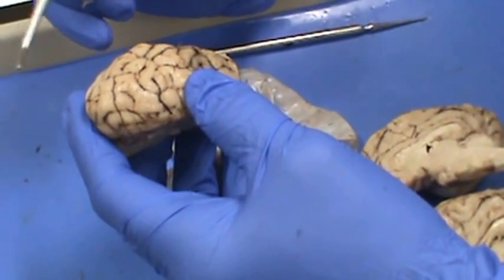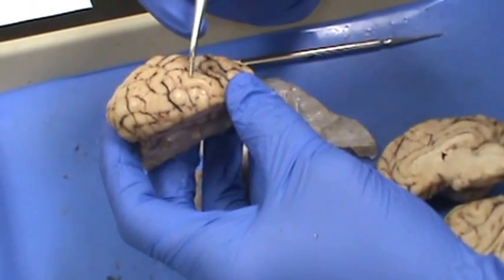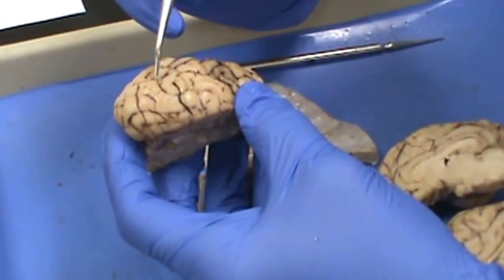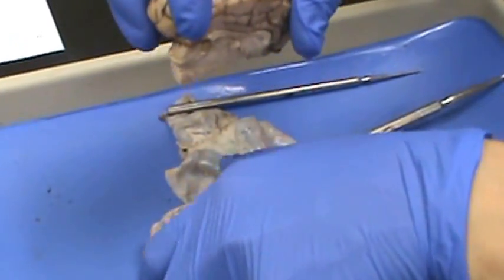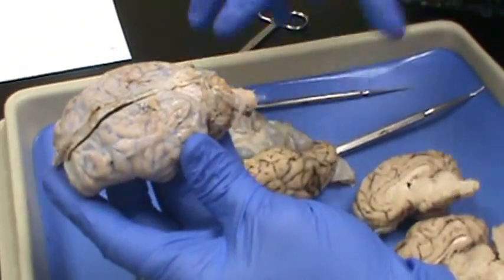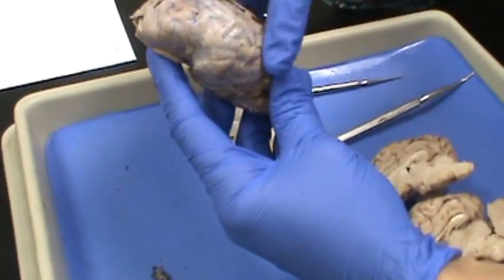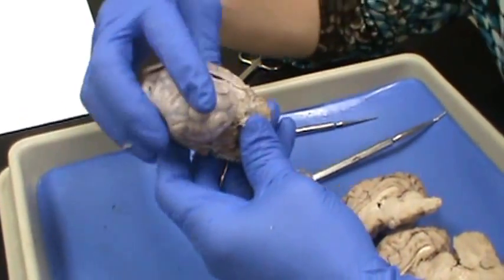Gyrus and sulcus: the gyrus is the raised areas and the sulci are the grooves or wrinkles. The part of the brain that has the gyri and the sulci is the cerebrum — the largest part of the brain. This is the cerebellum here.